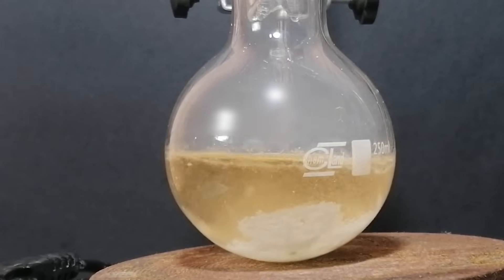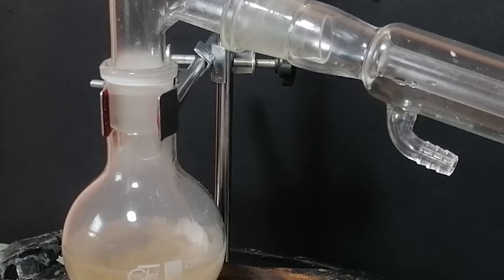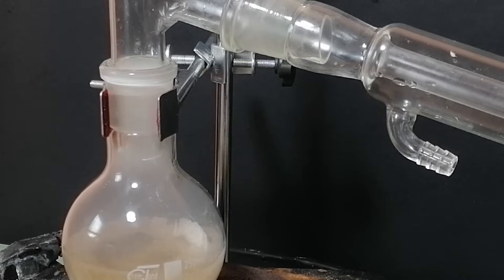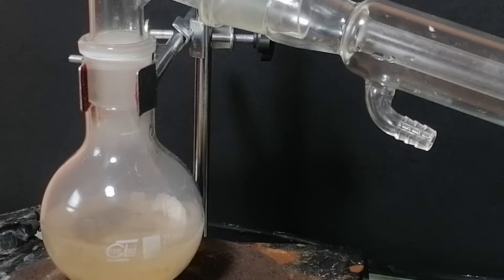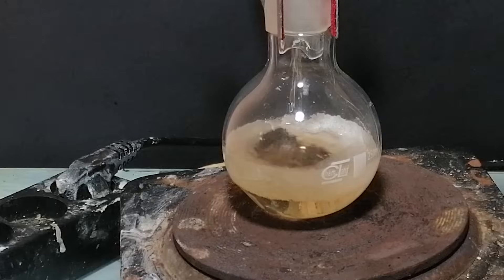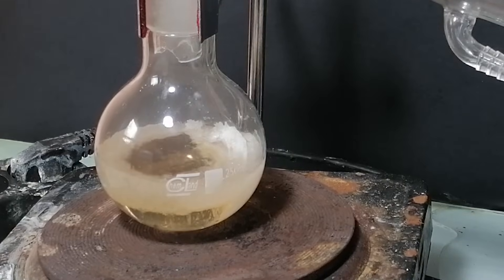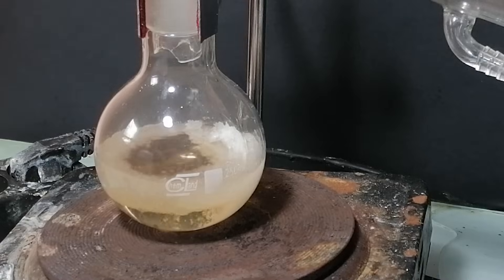Just look how angry it is. Now we can go into the proper segment of this, which is the distillation. As the solution gets boiled, the vapor condenses in the condenser into a liquid and drips down into the beaker. Because there is still some water in the system, this water will most likely form an azeotrope with the acetic acid and get boiled down first, so I'll be throwing out the first fraction. I don't have a thermometer, so this is kind of like doing surgery blindfolded, but I don't care because I'm a gangster.